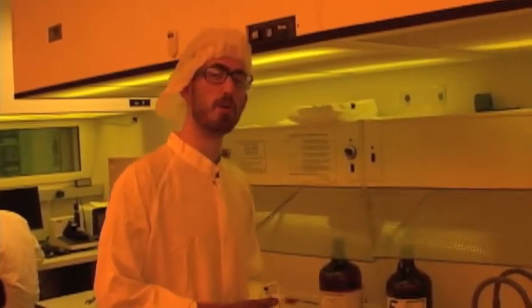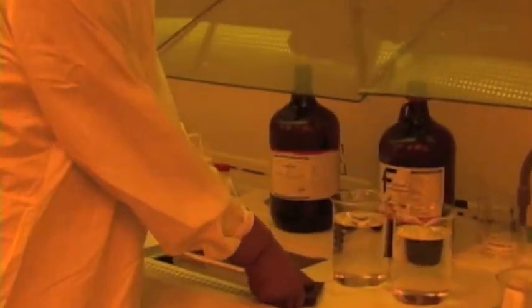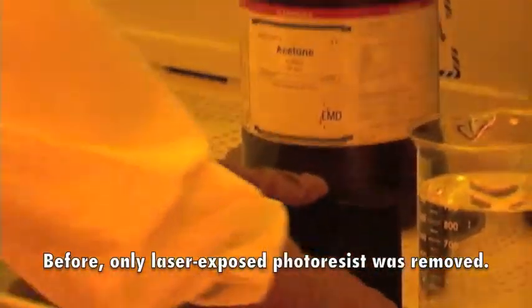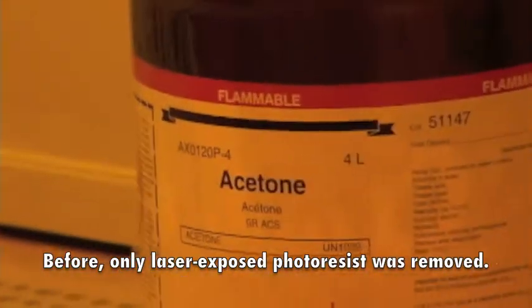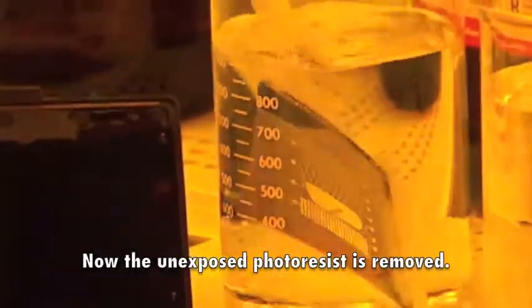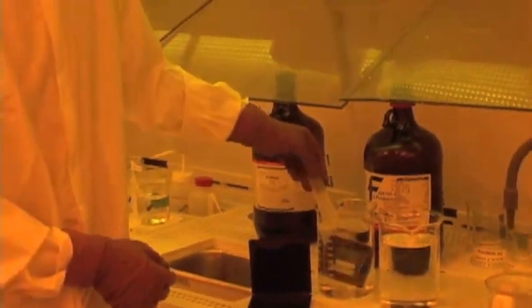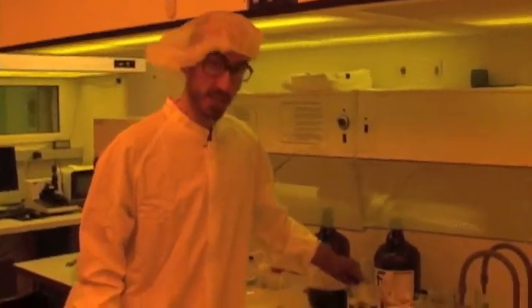Okay. So far we've removed the chrome from the mask, and now it's time to remove the photoresist. We're going to do that using acetone. Rubbing alcohol, about 30 seconds.